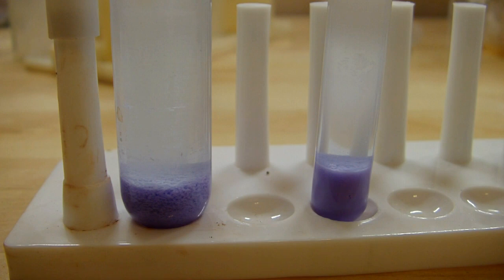What's on the left, I had to graduate to a larger test tube because I had to use a whole lot of acetone to get everything fully precipitated. So the one on the left was what's been from the rest of the video and the one on the right was just one milliliter of solution that I used as a test earlier.